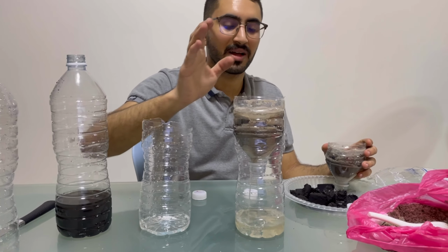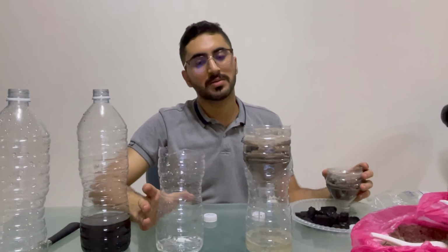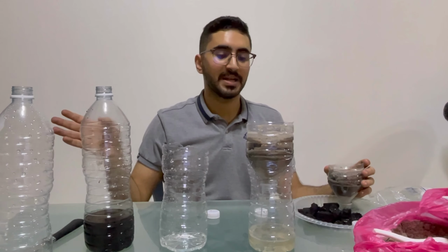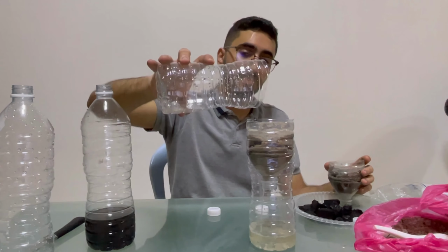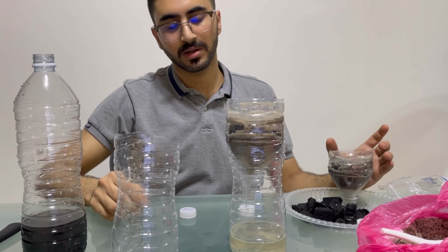As I said before, our material is so simple due to the condition that we have now. It's much better if it's in industries or any place that has the chemical materials that we can use. It will give much better results. But for this one, it's so far so good.